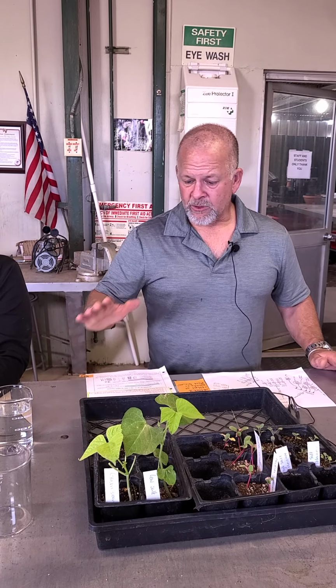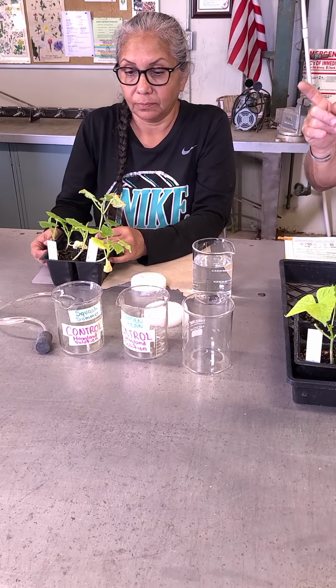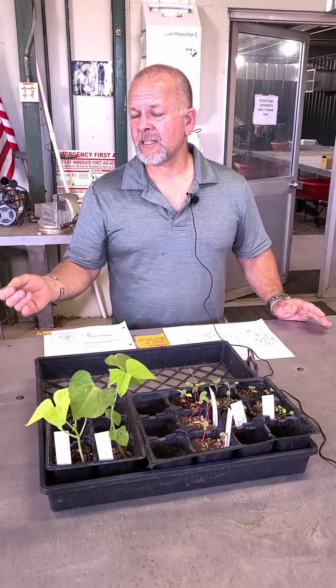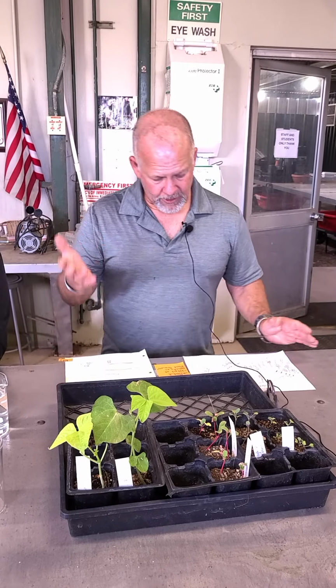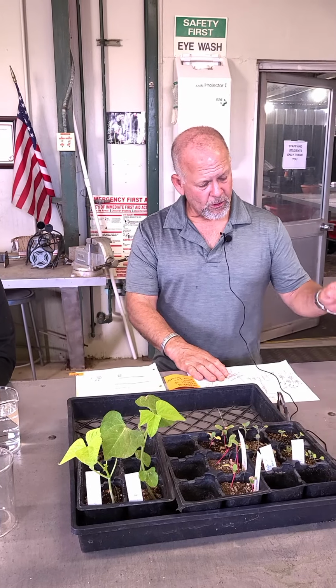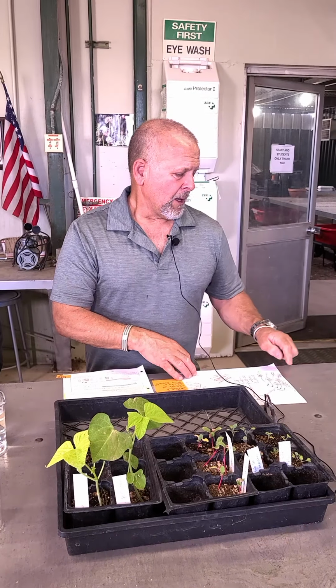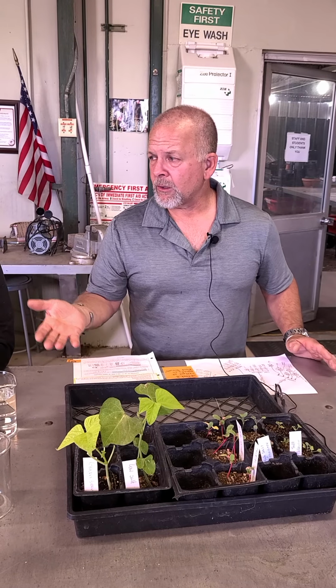So what we've done is we've taken the control, the low salinity, the medium salinity, and the high salinity. And we're putting 5 different kinds of plants in each one of those. So for instance, let me just take the control, and that's what Belinda's going to finish off here. If I just take the control, we've got garden beans, radishes, squash, kale, and beets. Those are our 5 different plants, and we're going to put those in each one of our treatments. So the control will have those, the medium, the low, and the high salinity will also have each one of those plants.